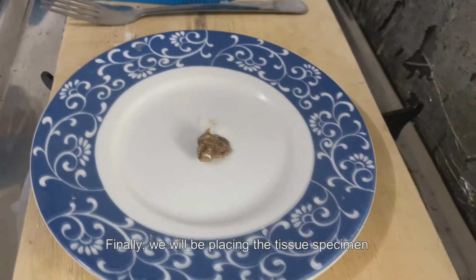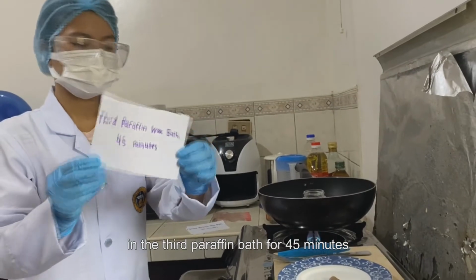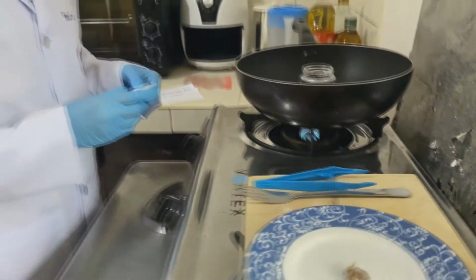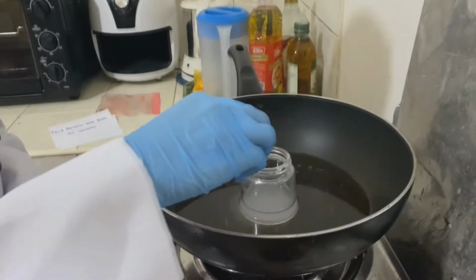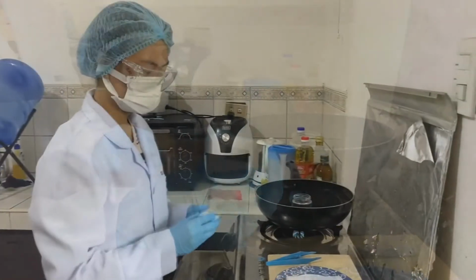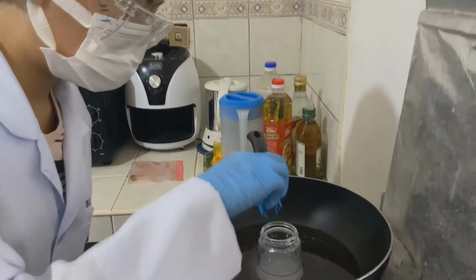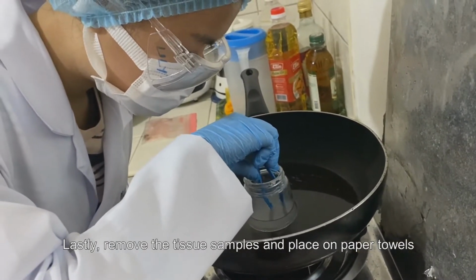Finally, we will be placing the tissue specimen in the third paraffin bath for 45 minutes. Lastly, remove the tissue samples and place on paper towels.